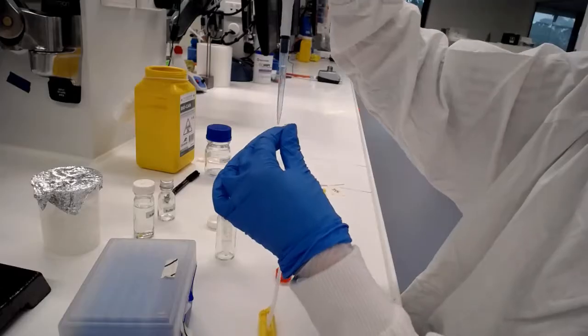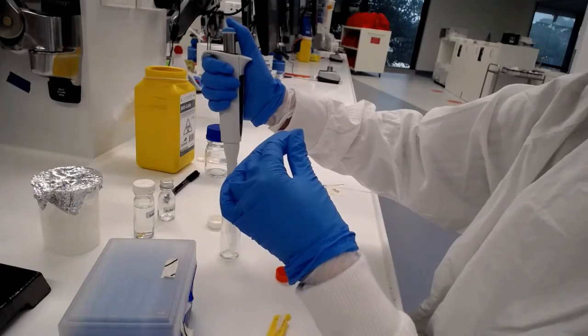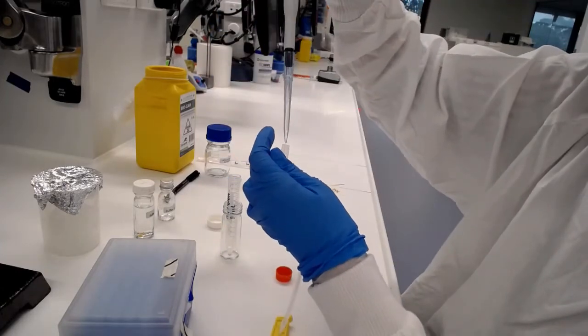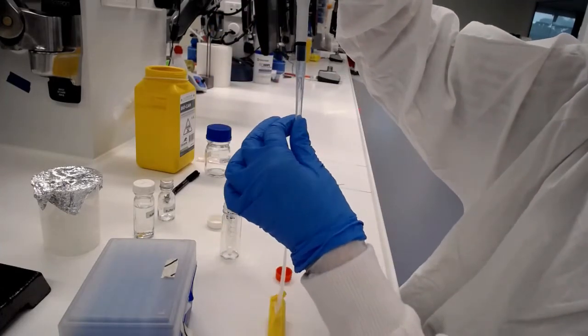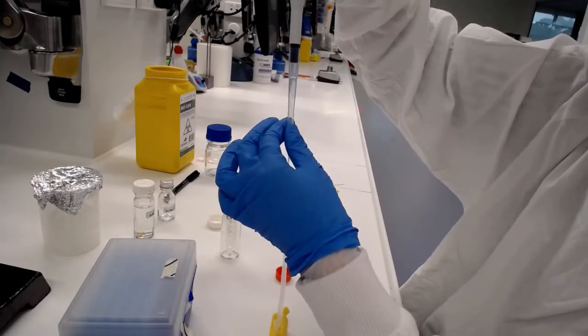You also have to kind of open up the tubing to help the solution get in there. We've got a bit more than three mils so it's going to take three or four goes with the P1000 to fill that tubing up with our crude PFU protein preparation.